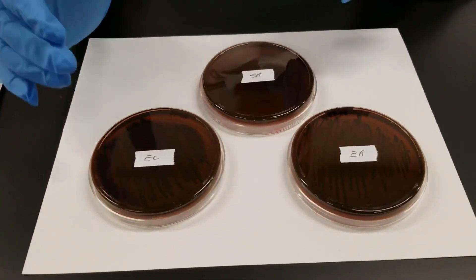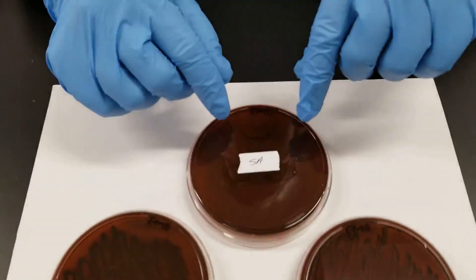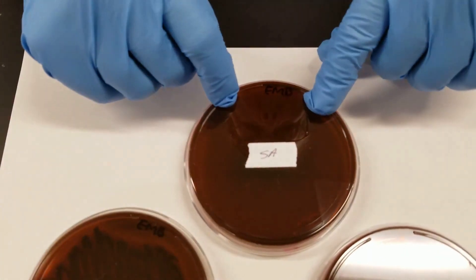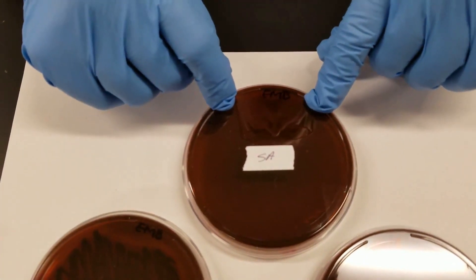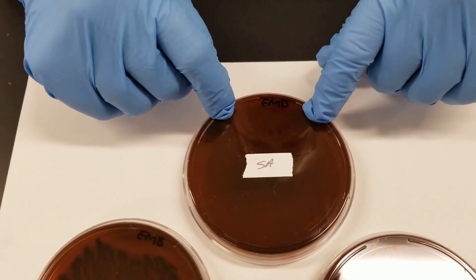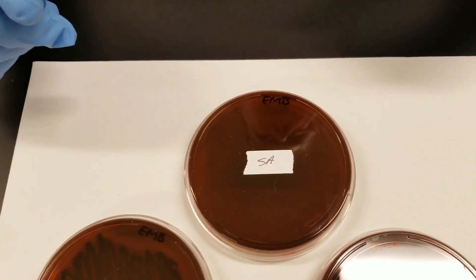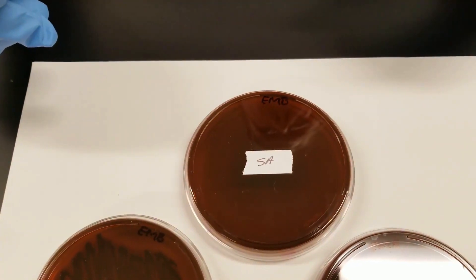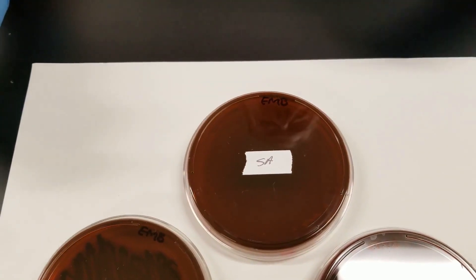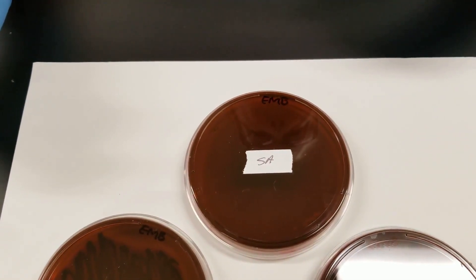Once again, only gram negatives will grow. This plate up here at the top was inoculated with Staphylococcus aureus, which is a gram positive. We did not have any growth — that is what the plate originally looked like — which makes sense because gram positives cannot grow on EMB.